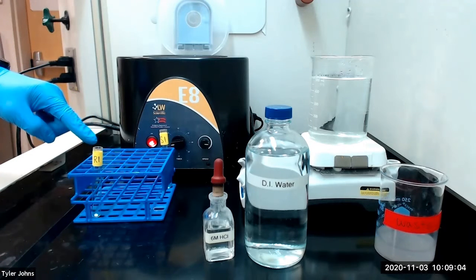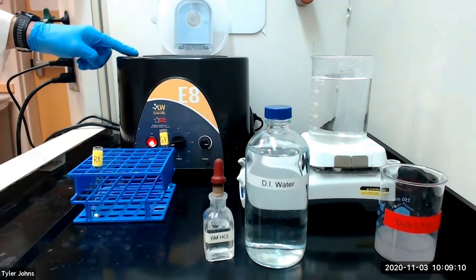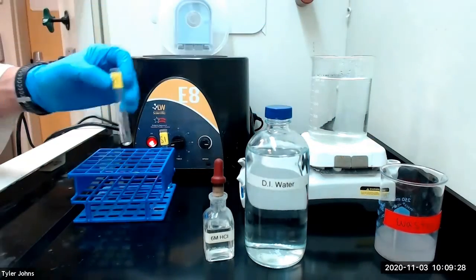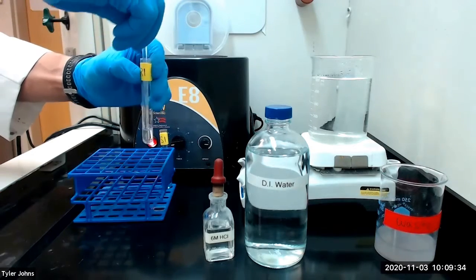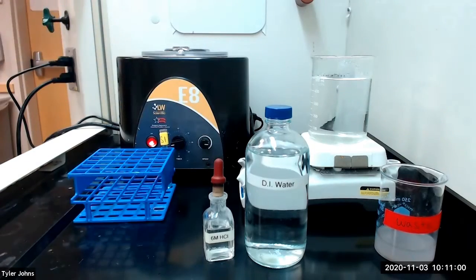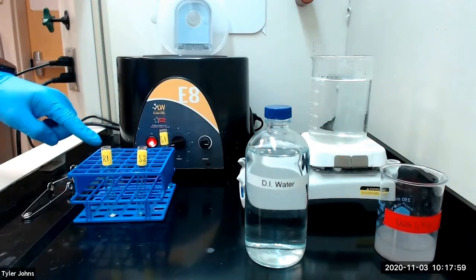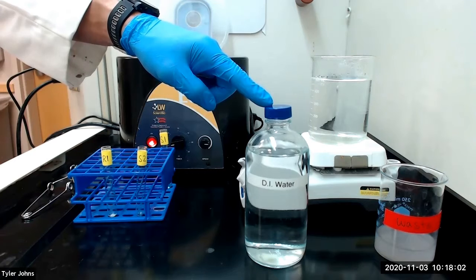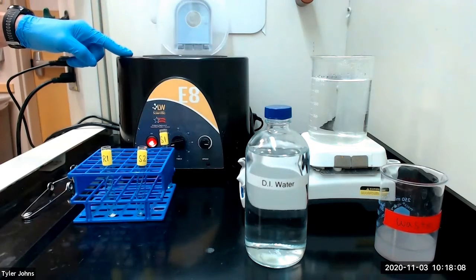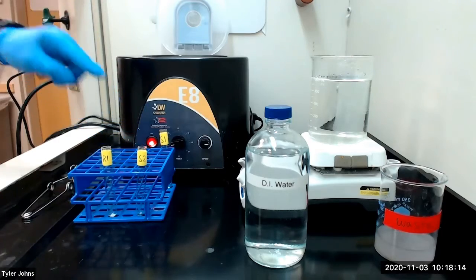We will next wash residue R1 with 1 milliliter of deionized water. We will stir the mixture, centrifuge, and discard the wash liquid. To residue R1, we will next add 3 milliliters of deionized water and then heat the mixture to near boiling with stirring. We will then centrifuge the heated mixture and after centrifugation, decant the solution to a new test tube labeled S2.